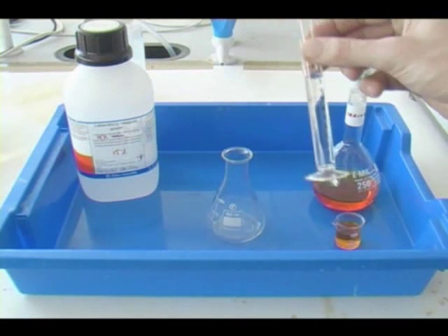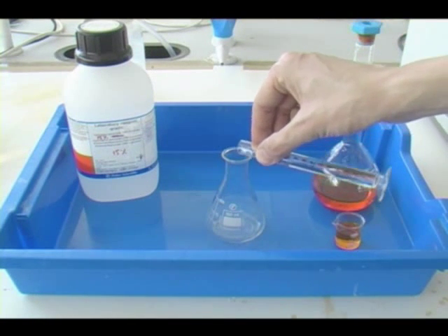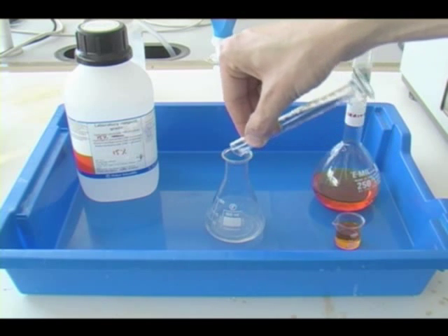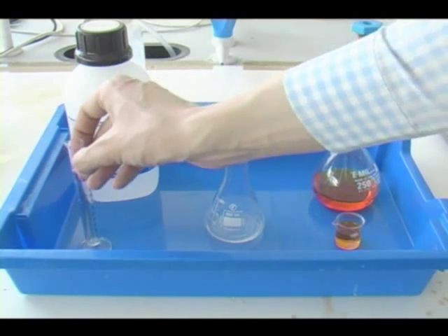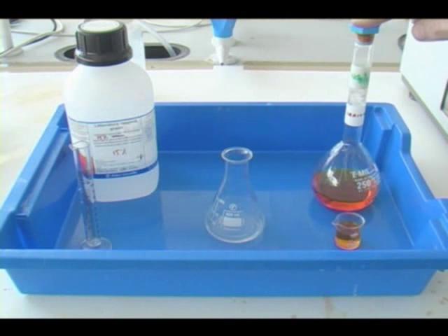Here I'm going to pour 10 millilitres of hydrogen peroxide into a conical flask. The decomposition to form oxygen gas is very slow at room temperature.